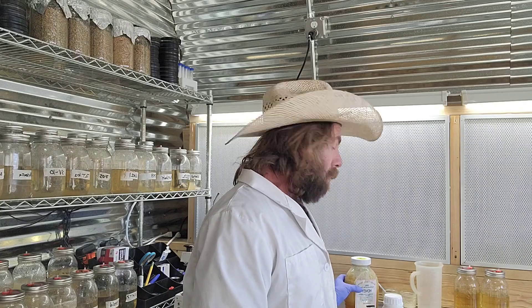To do something special for Terence's birthday, I went over to that valley in Paonia and picked up some local honey. We are going to make some liquid culture for growing mushrooms — figured Terence would appreciate that. Not only are we making liquid culture, but we're going to supercharge it with a special ingredient: soya peptone, which I'll talk about how much to use.